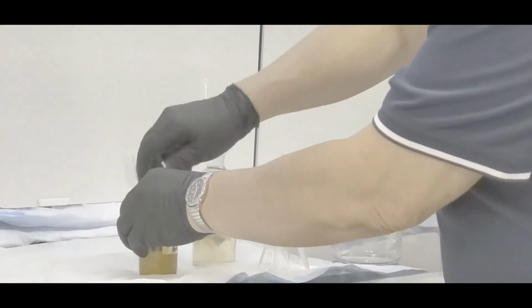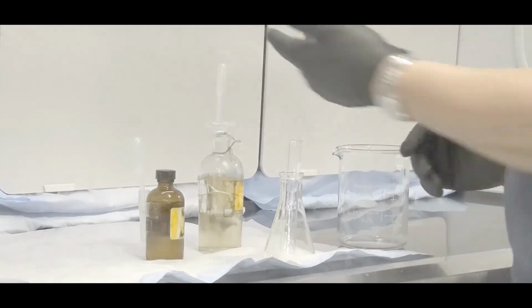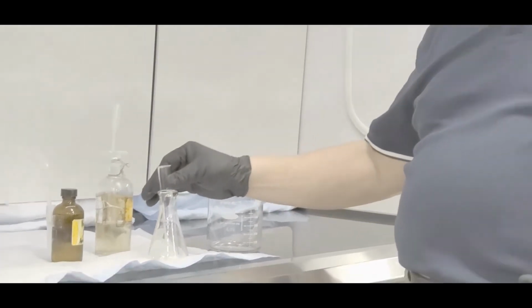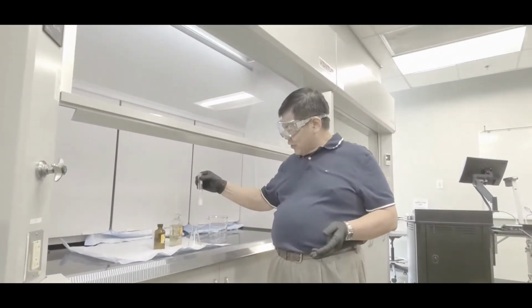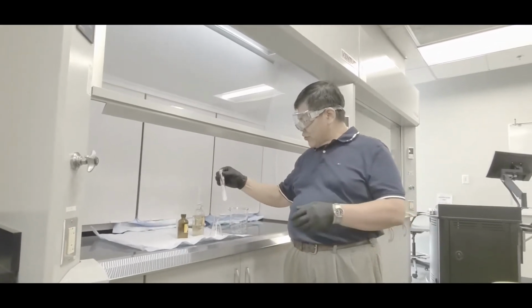Close both bottles. That's a good habit. Always close it afterward, okay? And then what you want to do is this. You want to just kind of wag the test tube a little to mix it. So go take it out and go like this. Wag, just like a dog's tail. Wag. Okay, like that. And then you take that to your station, okay?